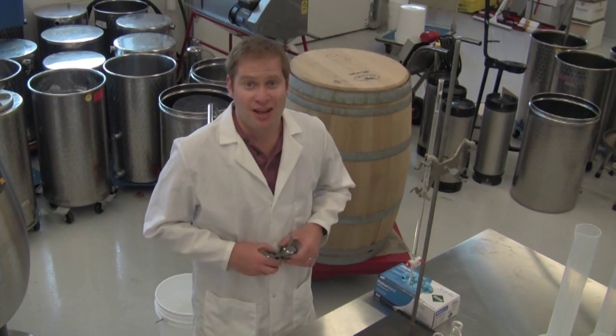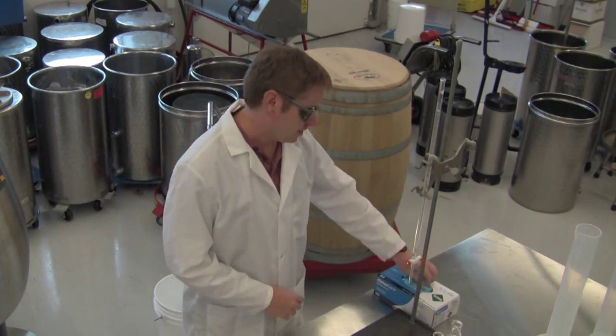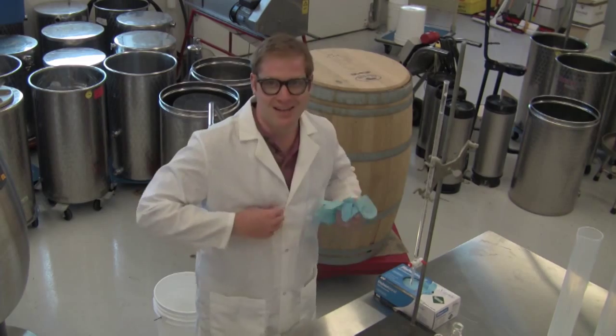Today we're working with strong acids and bases, so it's important to wear our safety equipment, including glasses, gloves, and a lab coat.